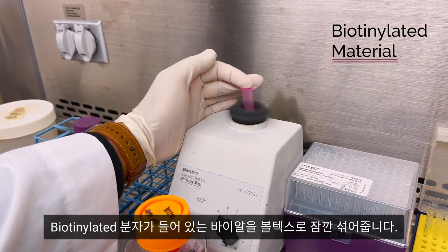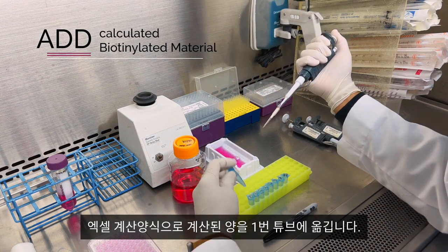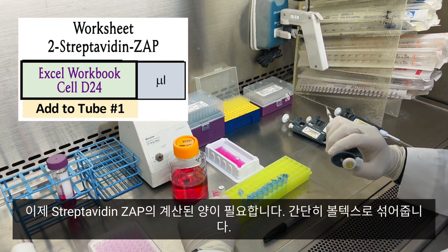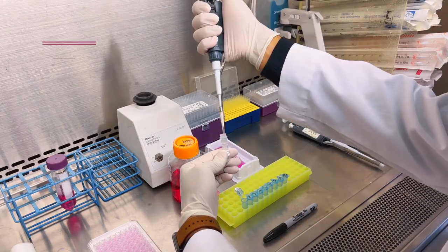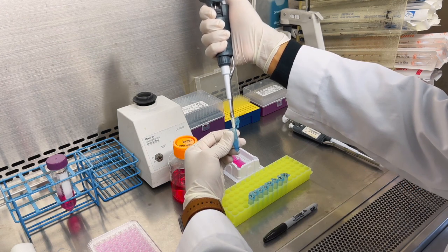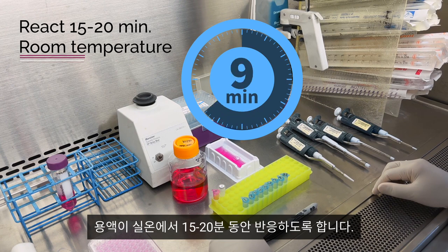Take the vial with the biotinylated molecule and vortex briefly. Take the amount calculated in the workbook and transfer that to tube number one. Now we need to take the calculated amount of streptavidin-ZAP, vortex briefly, add it to tube number one and pipette up and down a few times to mix. Vortex briefly. We want the solution to react for 15 to 20 minutes at room temperature.